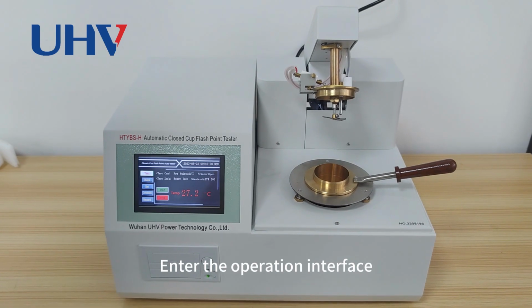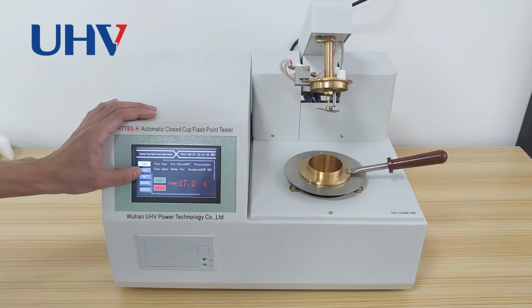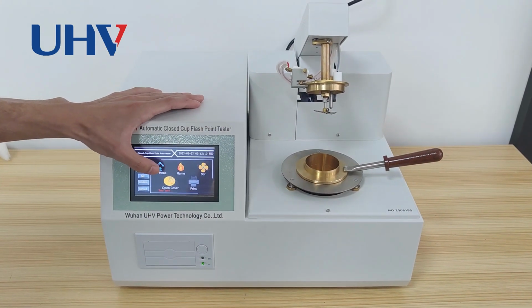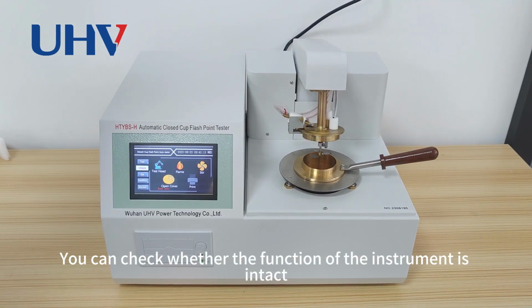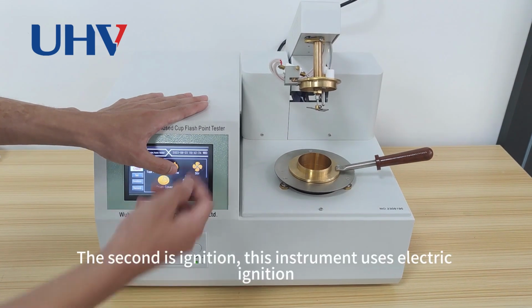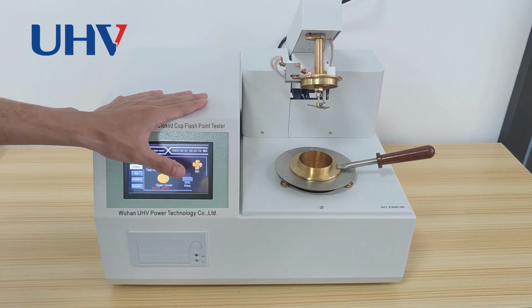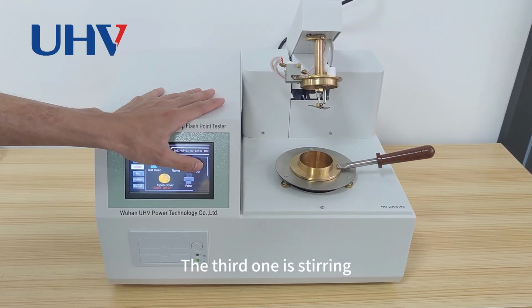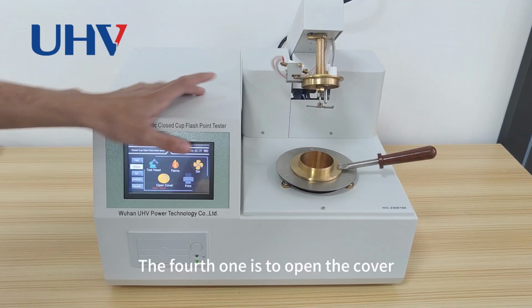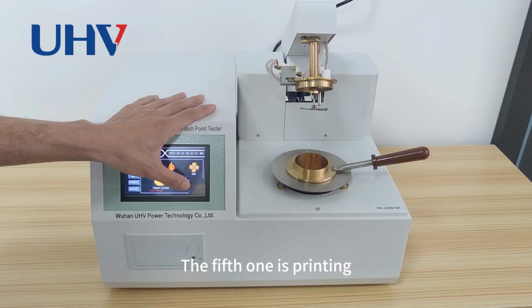Enter the operation interface. The first one is to view the current temperature. This is the self-check of the instrument. You can check whether the function of the instrument is intact. The second is ignition. This instrument uses electric ignition. The third one is stirring. The fourth one is to open the cover. The fifth one is printing.